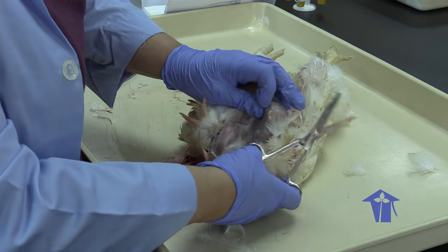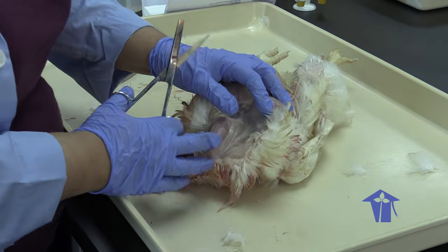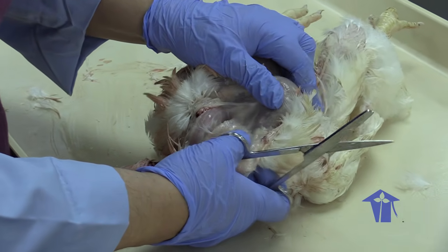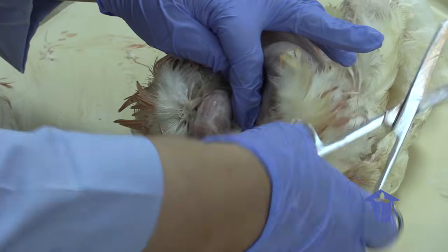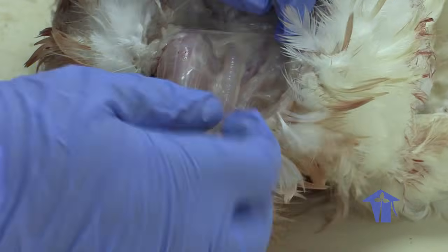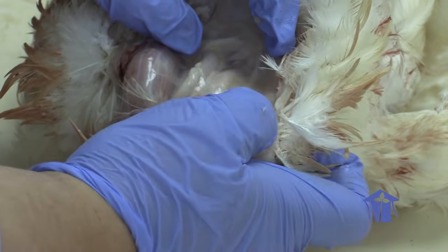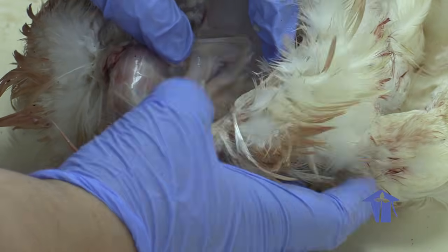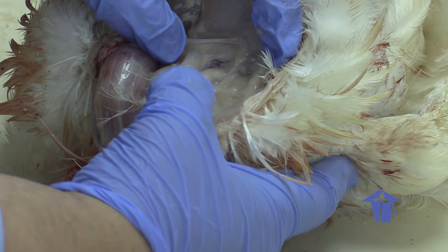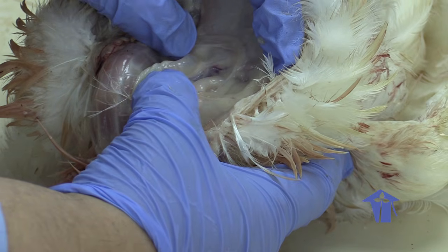So that food goes from the mouth into the esophagus, and the esophagus is that neck there, which some people consider a delicacy. So you're seeing two tubes here. This tube that's a little firmer and more rigid is the trachea, so that's for the airway.